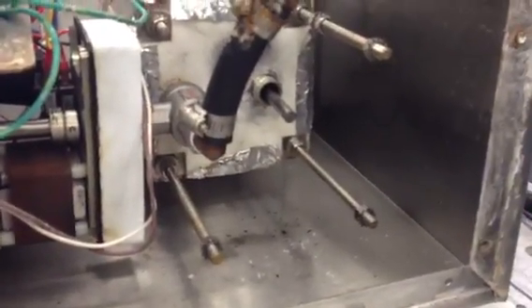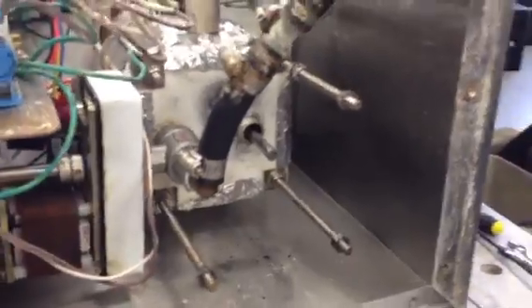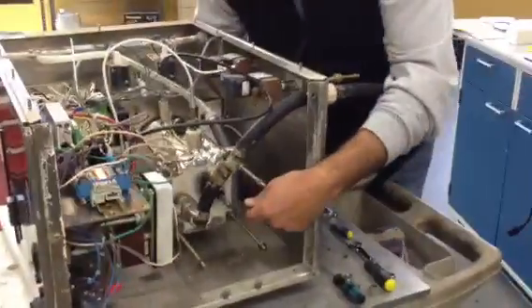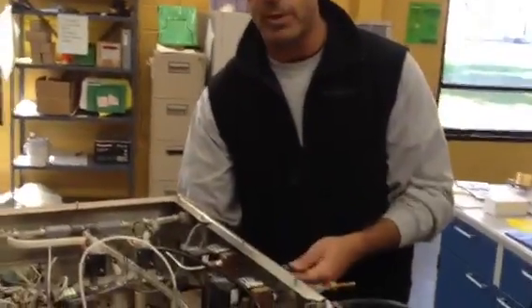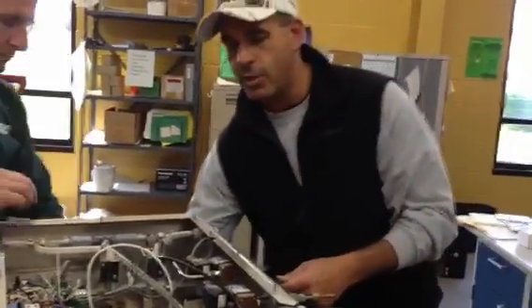And this part, it's a lot easier if you have somebody else to help you with this. You can hold the agitator from this side and start putting the packing in. If you can grab somebody else for 5 minutes, it makes the job a lot easier. I'm going to have Tom hold the agitator for me so I can show you inserting the packing.